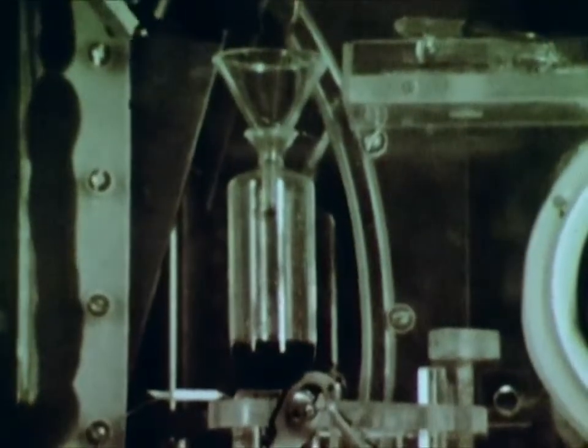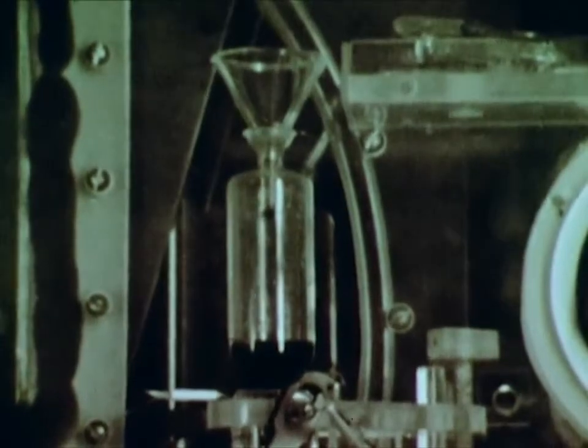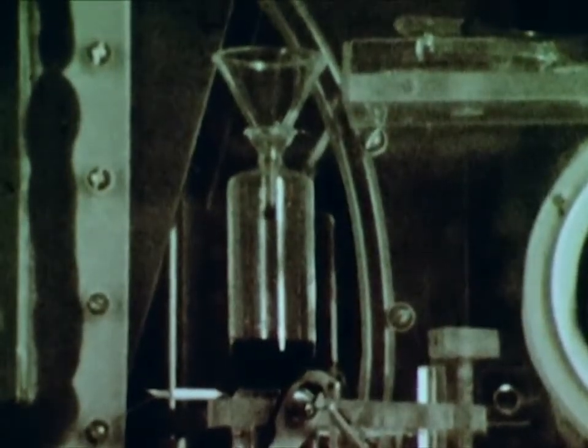Actually, one of the critical steps in the discovery of any element is its chemical identification. We must prove that it has chemical properties different from all previously known elements. Elution behavior in an ion exchange column can provide such proof. Here we see transuranium elements being separated by this method. The material is so radioactive that a four-foot wall of water is used as shielding. The materials are fluorescent, and with the lights off, can be photographed by their own light. This separation actually requires nine hours, but with time-lapse photography, we observe the entire process in 15 seconds.